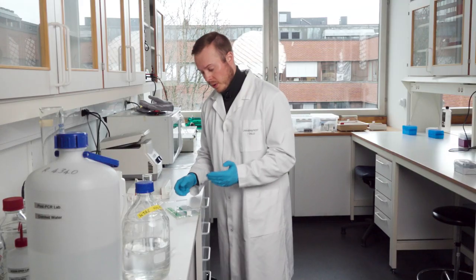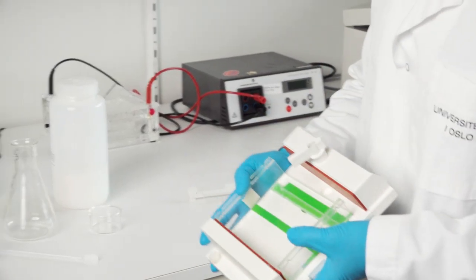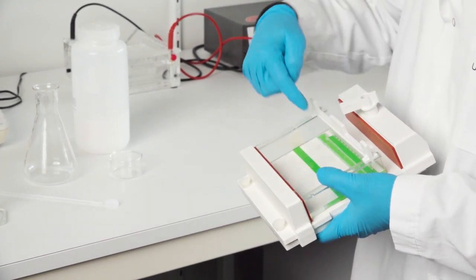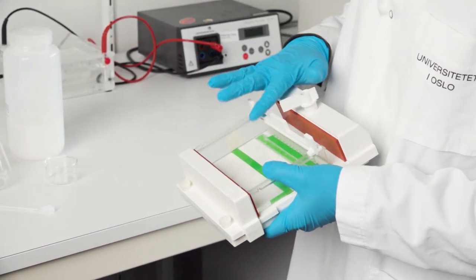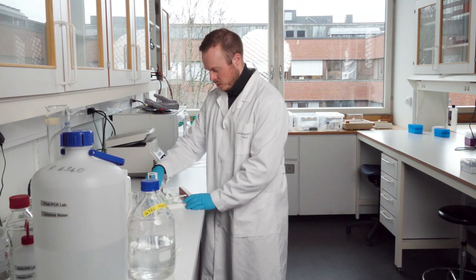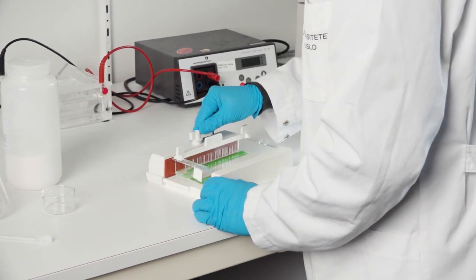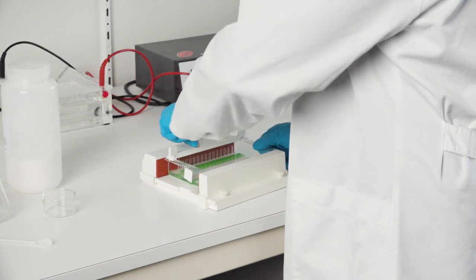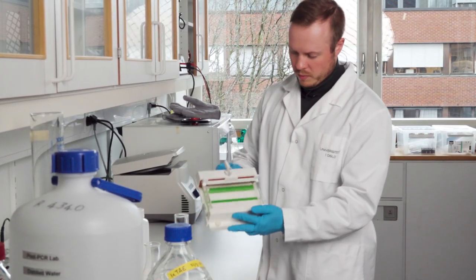My preference is to set up the mold first. We've used green tape here in the gel tray and align it together. This makes it way easier when pipetting samples because it's much more visible. Try to align the row of teeth with the green taped line. Then take the mold and secure it so it's tight because it needs to hold the solution. It's a little finicky, but now it's very tight and secure.